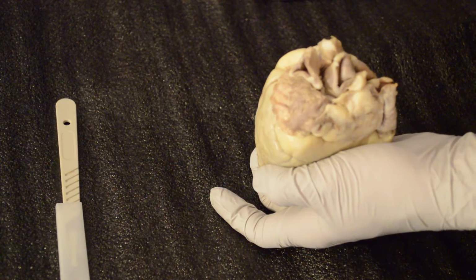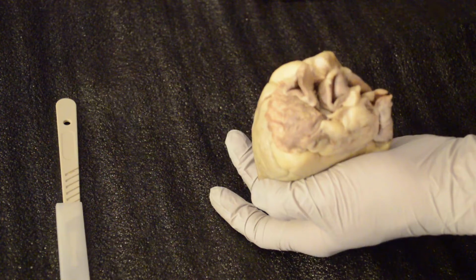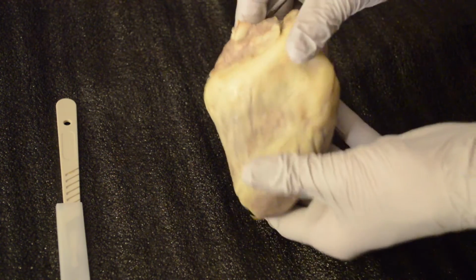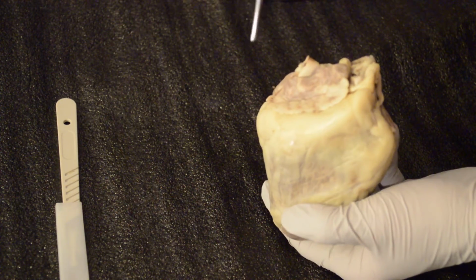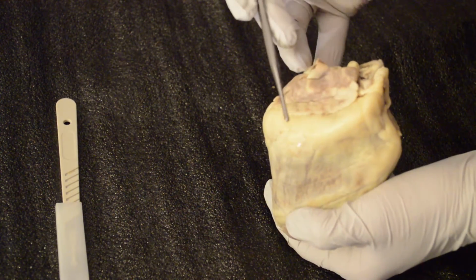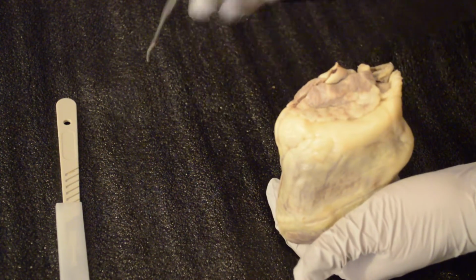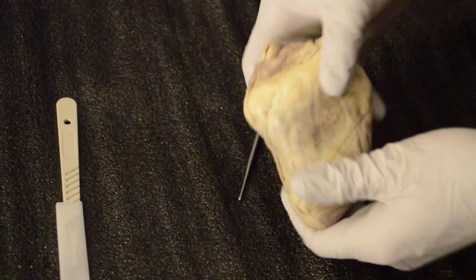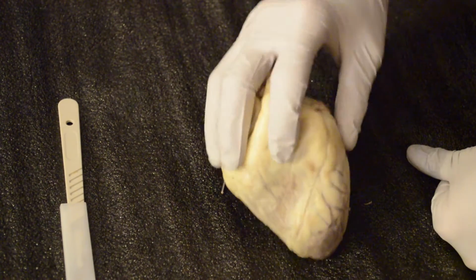And with the aorta itself, there are 6 different parts to the aorta because it's probably the largest artery in the body. First, we'll have the aortic root. The aortic root goes into basically the ascending and descending part of the artery itself. It's part of the left and right coronary arteries. The aortic root actually supplies the heart and oxygenates the blood. So we've got to remember that. It's really, really important.